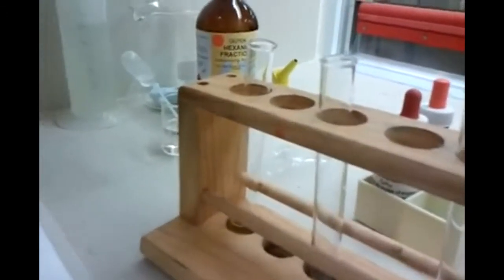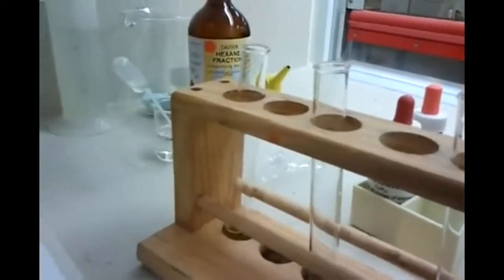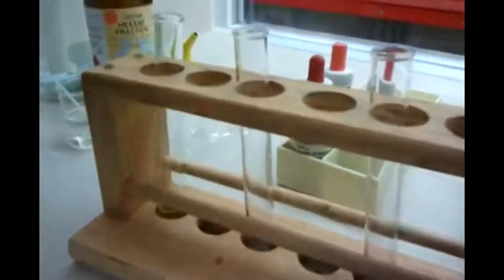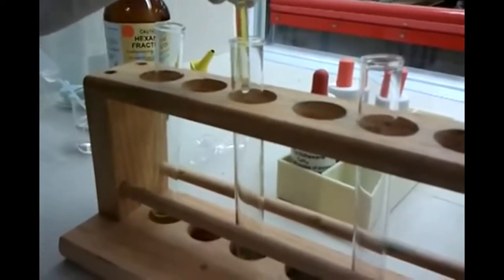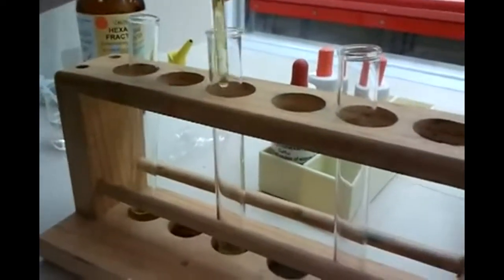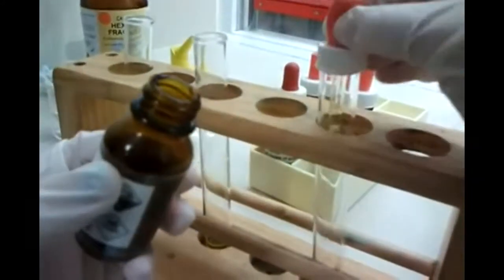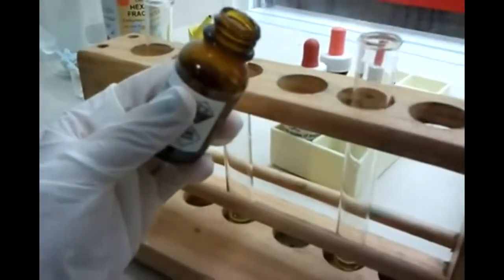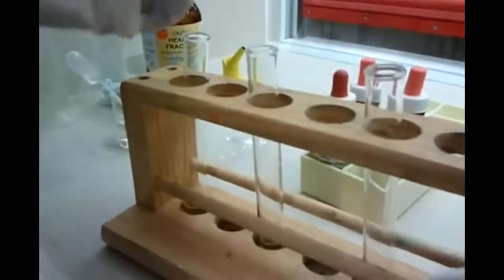I didn't know what it was. Don't worry. There we go. So then it's yellow. Now we do it for the other three. It says in every test tube. Each test tube. Speed up the process. Oh, fudge blossoms. Who says fudge blossoms? I don't want to swear anymore. You think dirty. That's like an equivalent. We started a contract with Sylvia thinking dirty.